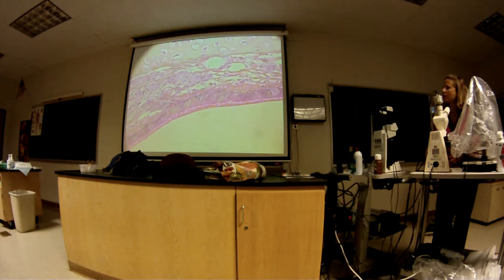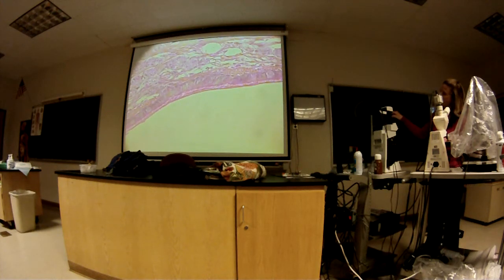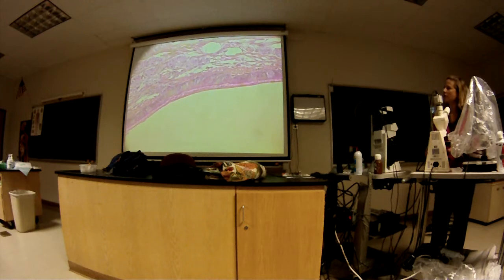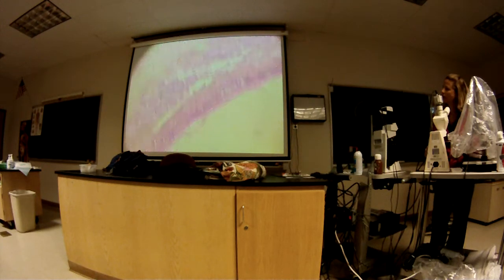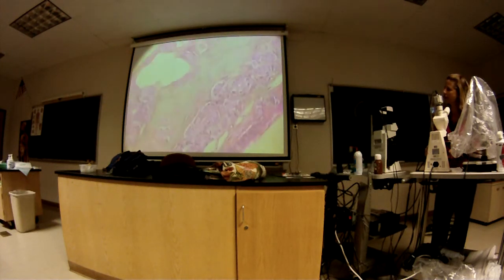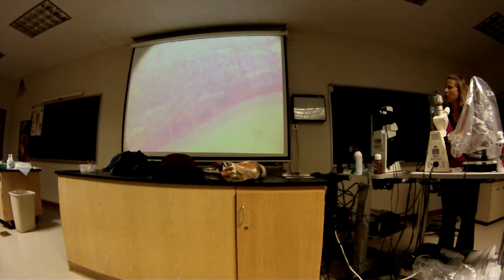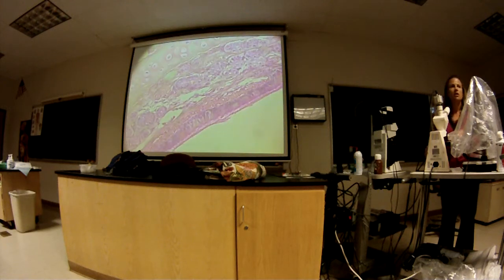Simple... Pseudostratified, I see the cilia. Yeah, see the cilia? Kind of the wavy looking stuff right there. There's a little layer of mucus there, so it made it look a little different over there, but it's more visible right there. Okay, so you know it has this tissue, what's this? Hyaline cartilage. That's hyaline cartilage, so what is that whole sort of oval structure? What are we looking at? What organ? A cross section of a bronchus. Yeah, it's a bronchus.